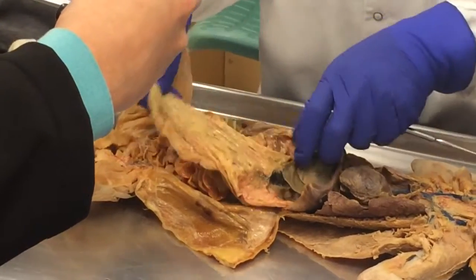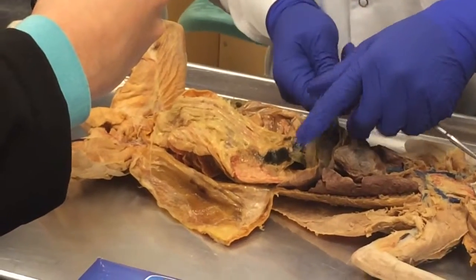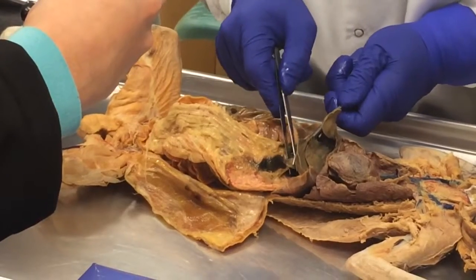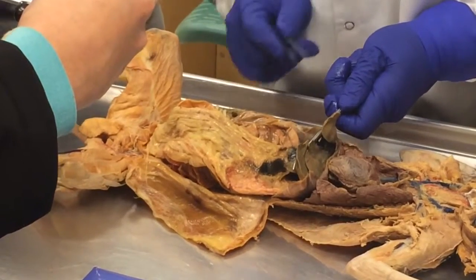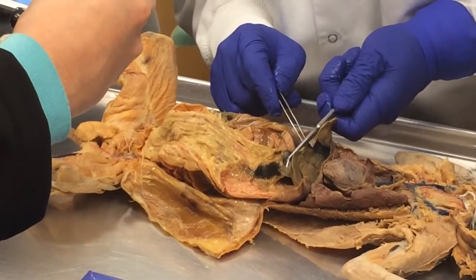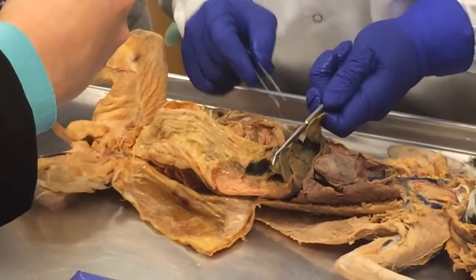All right, we're going to put this back a little while so that we can go to the lobes of the liver, which were in the exam, at least mostly for the human. So this pointy one is the caudate lobe. We can't see the ducts for the gallbladder, but it was in the exam.